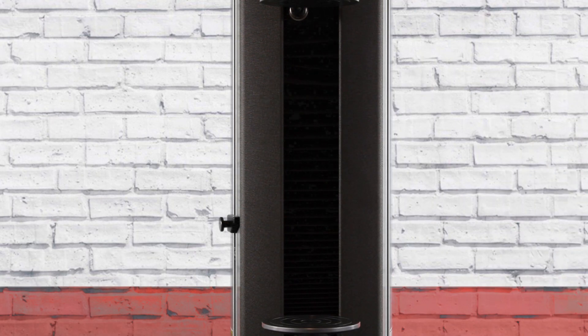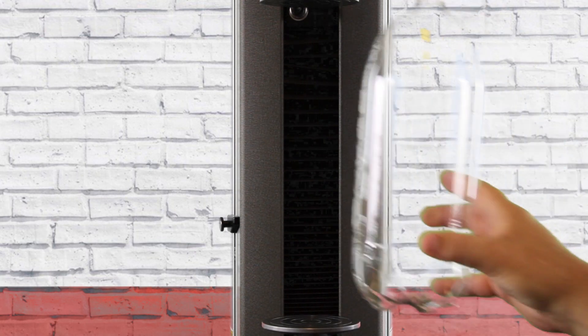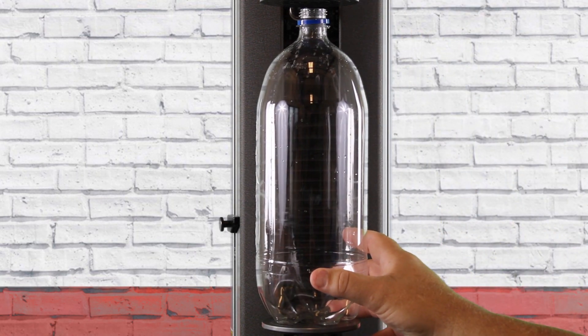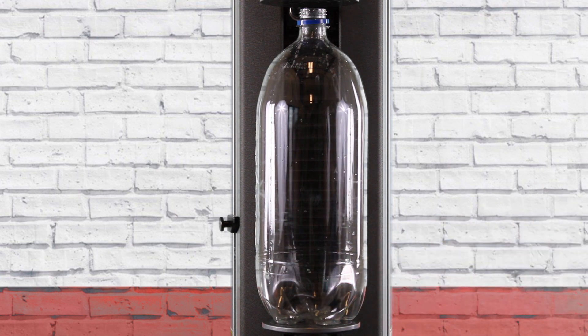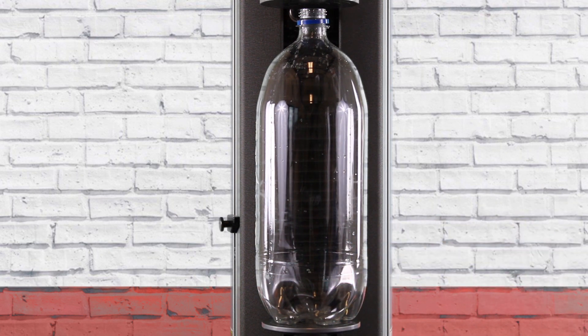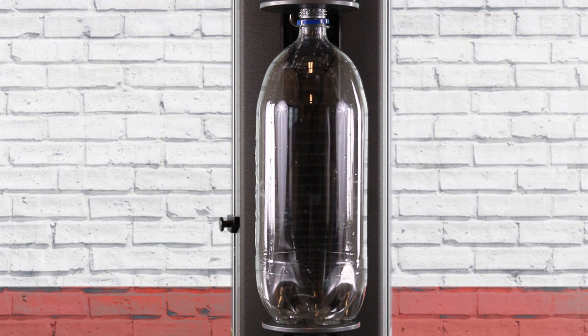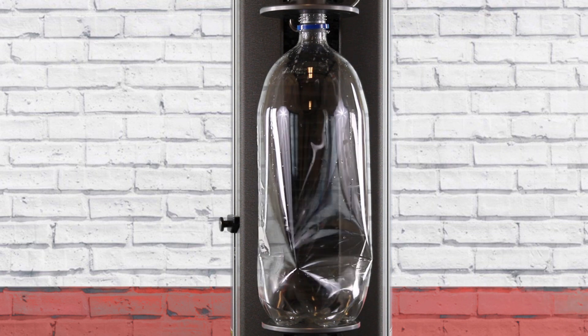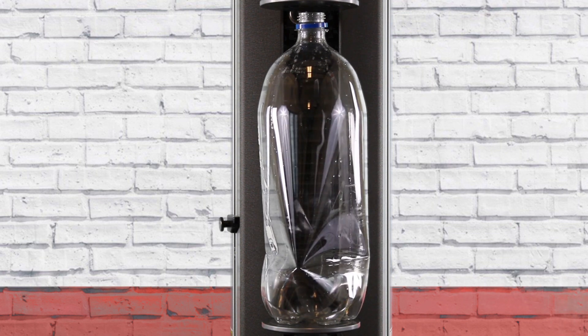Let's go ahead and reset the bottle for one more test. We'll put it in there and let's do one more. Here we go, here's the second test. See the system coming down the bottle and that's it.